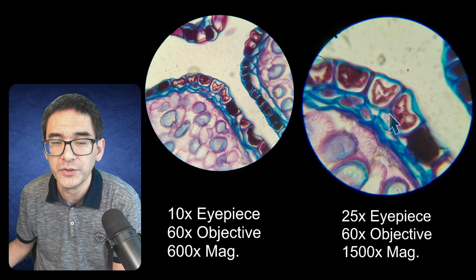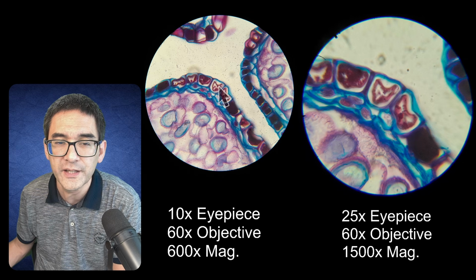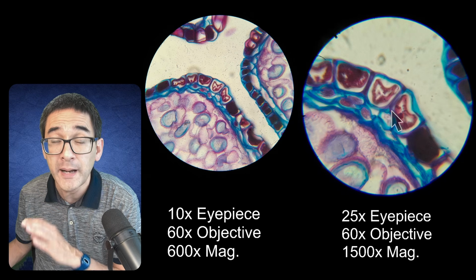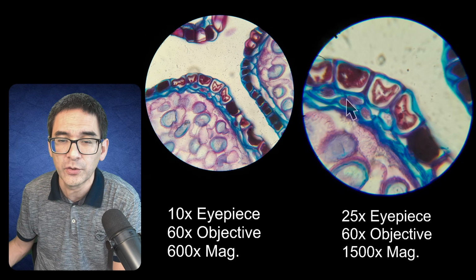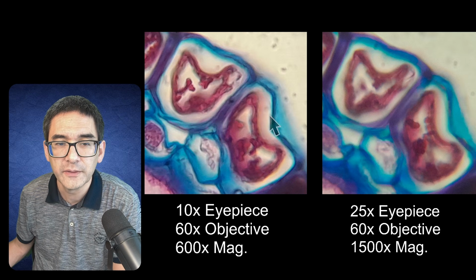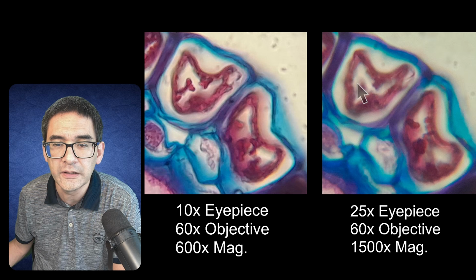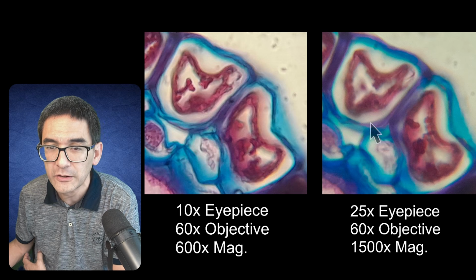Let's have a focus on here. We want to actually look at the central part over here, and I would like to compare them right now. Okay, so let's bring both of these central parts up to the same magnification on screen, so that we can compare that directly, because right now we cannot compare them because the magnification is different. Yeah, this is how it looks, right? You see this picture on the left, it looks much more clear than this one over here. Yeah, it does look more blurry, even though this one has been magnified more. So I did not have to magnify it as much on screen, but still it looks blurrier.